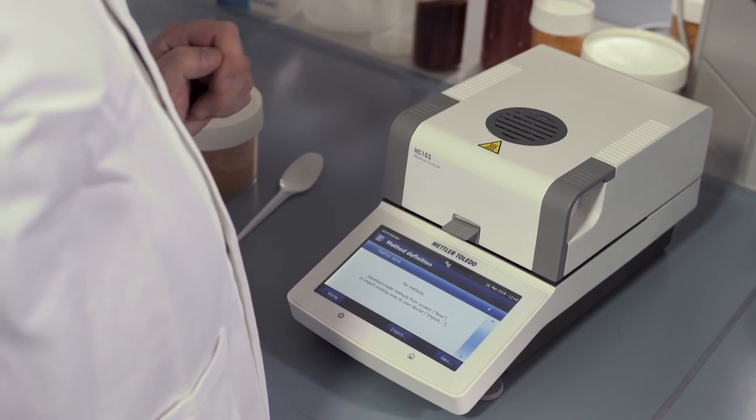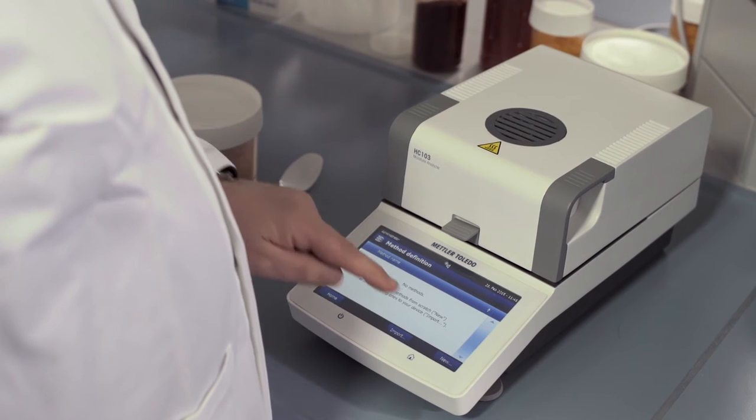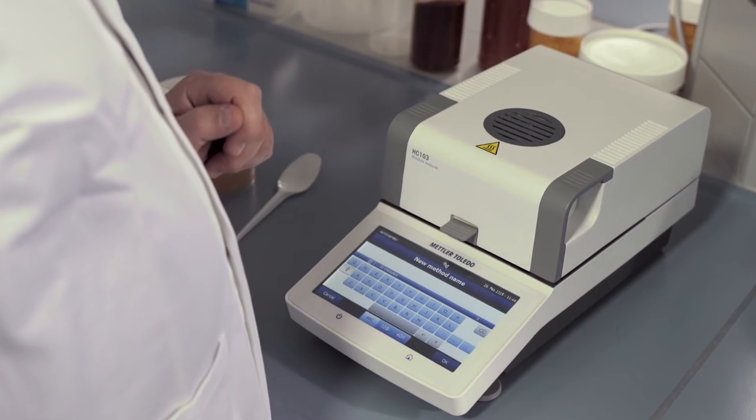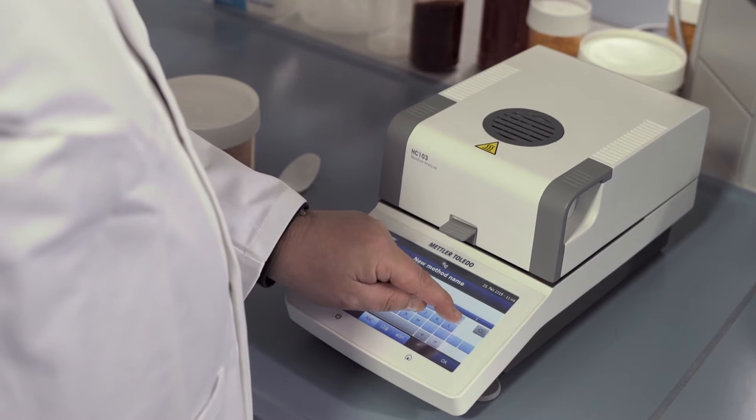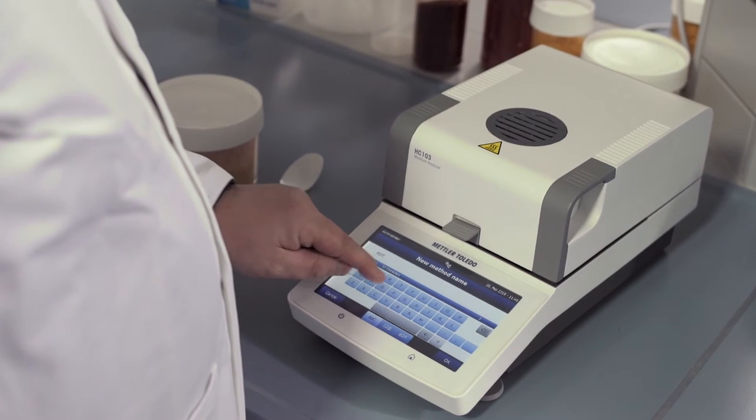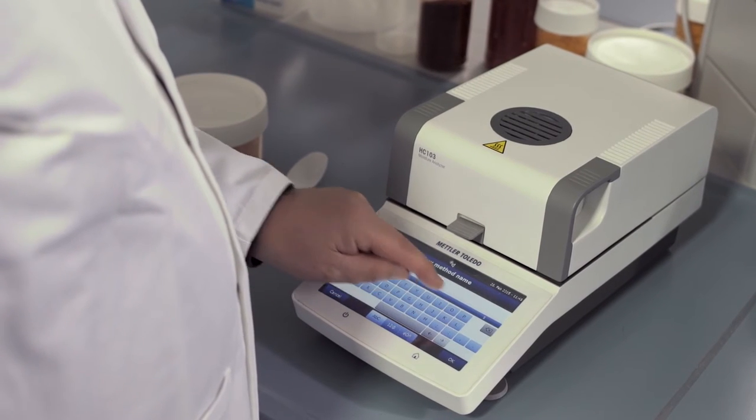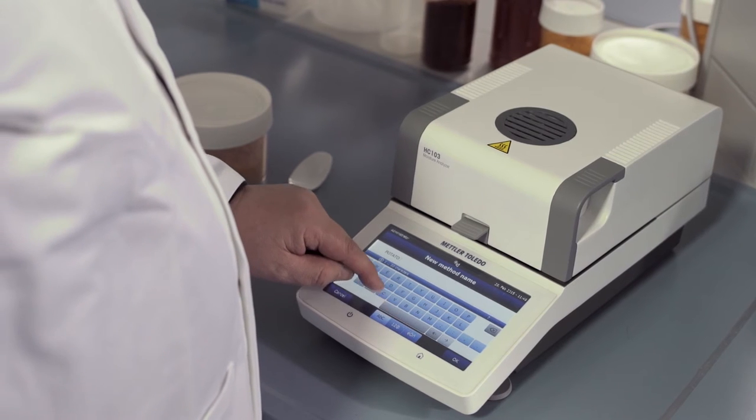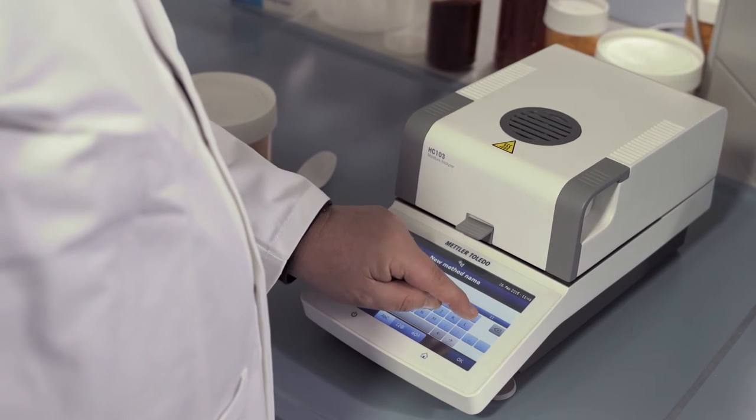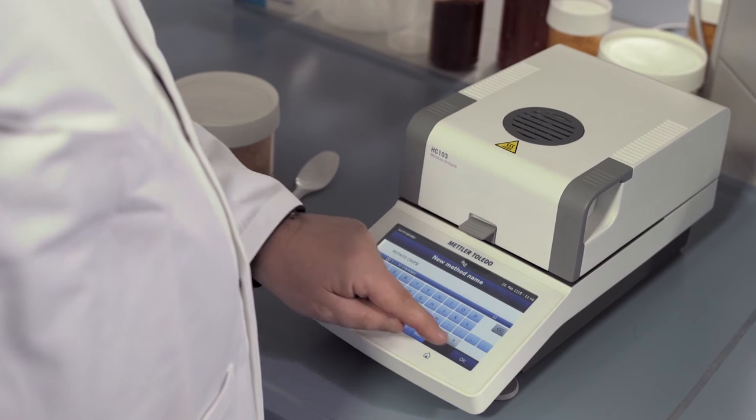Press Method Definition, New, type in potato chips, and press OK.